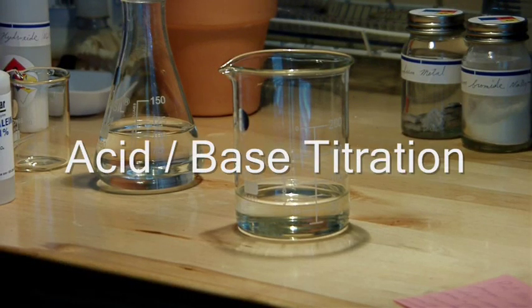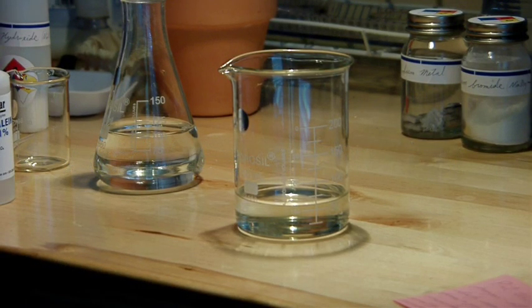In this video I'm going to demonstrate how to do an acid-base titration. So I'm trying to figure out the concentration of commercial hydrochloric acid that I bought from Home Depot. And it has a measure of concentration directly on the bottle, but it's always good to make sure.